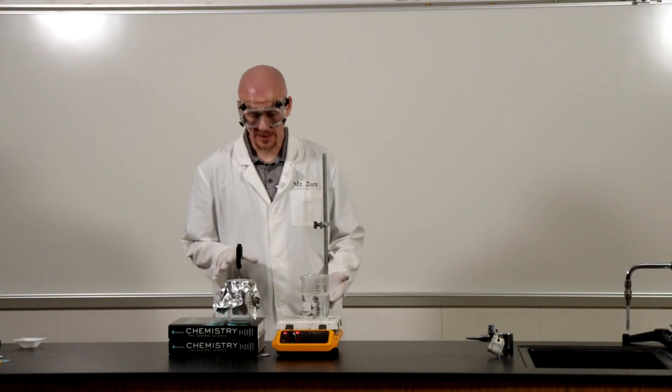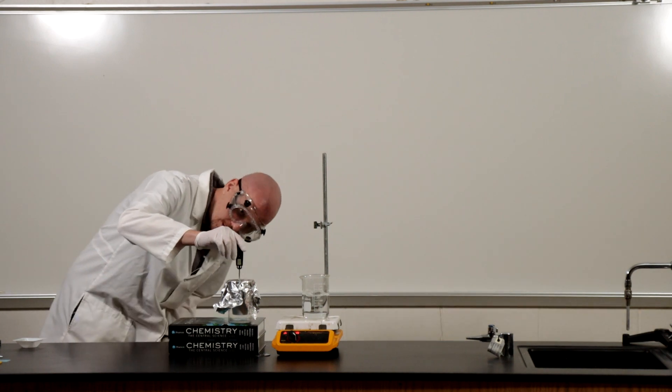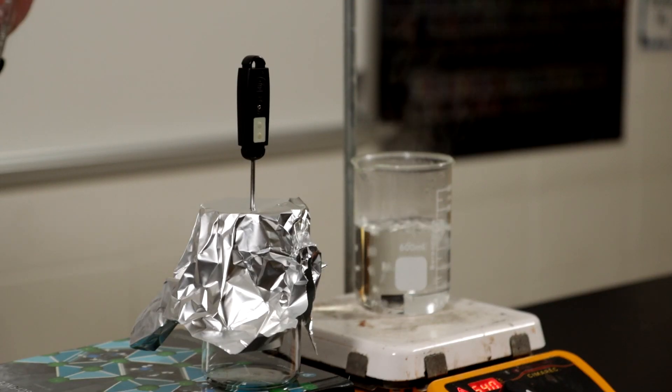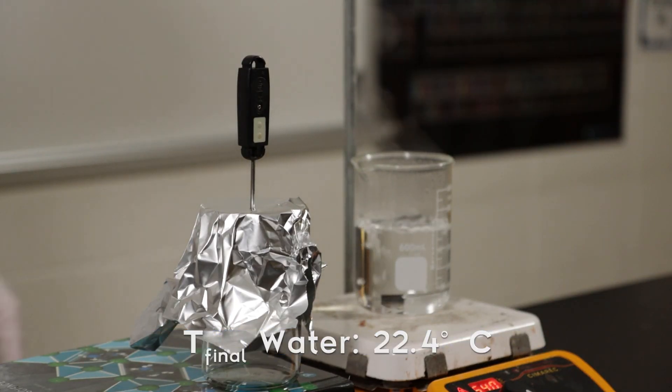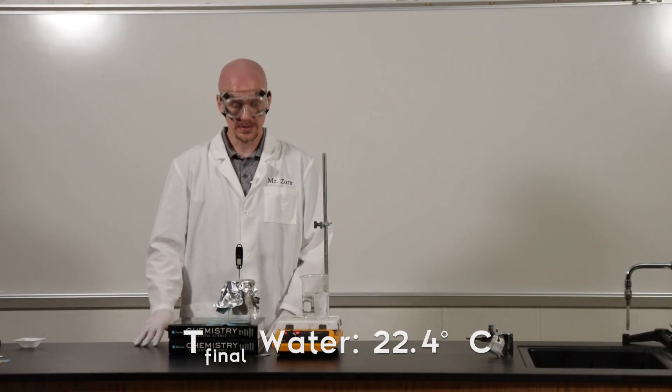All right, so I've let the sample sit for a couple minutes. I'm going to take my final temperature reading here. So we're at 22.4 degrees Celsius.